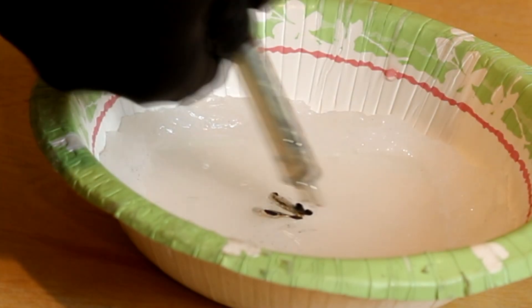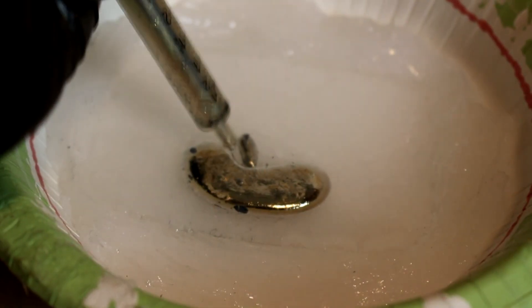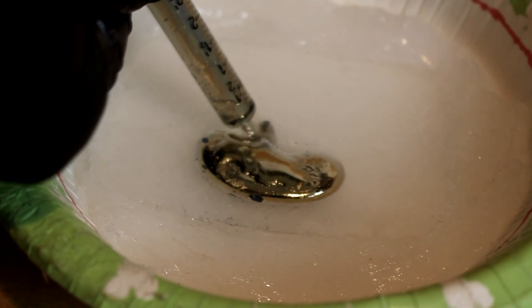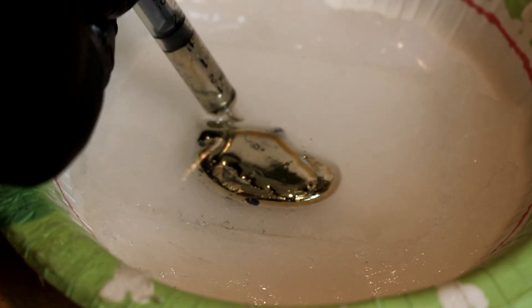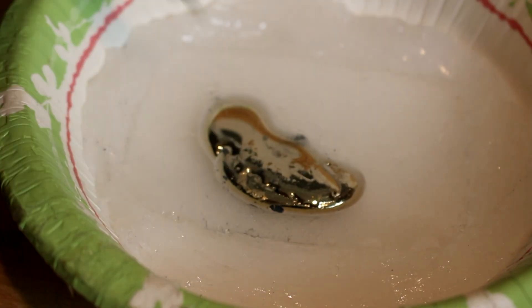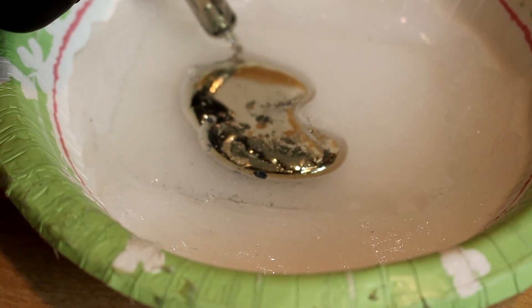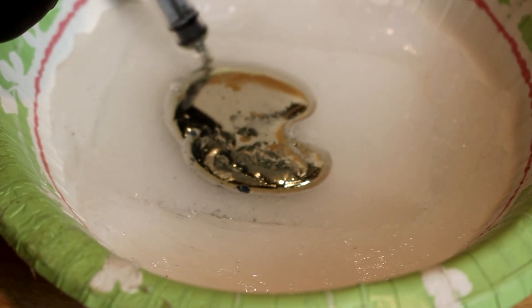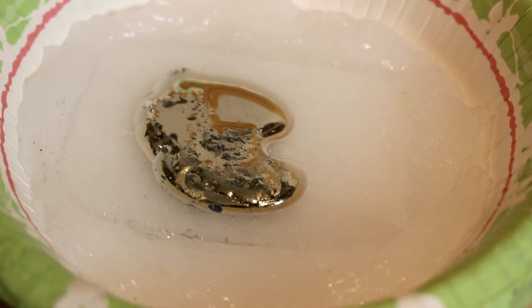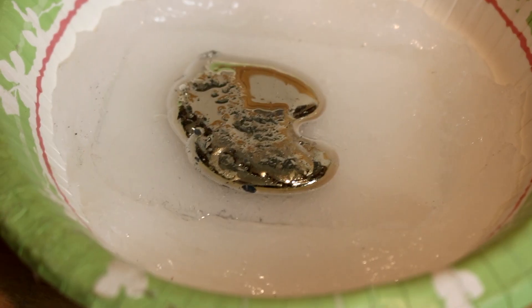Under the liquid. So here's the second squirt of cesium. I can see that the cesium is already setting up a little bit, so I kind of have to work quick here. That is a lot of cesium. And supposedly it's more valuable than gold — even though I produced this quantity here for probably about two hundred dollars, not including my time of course.